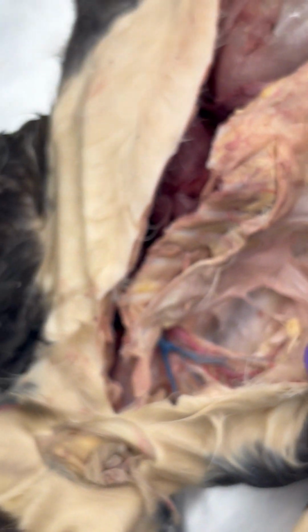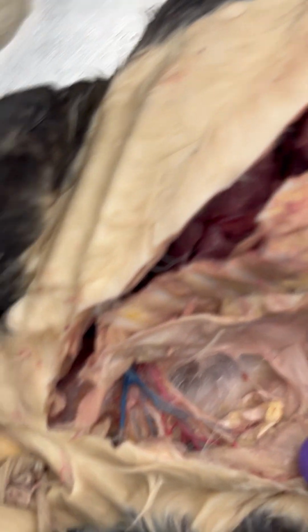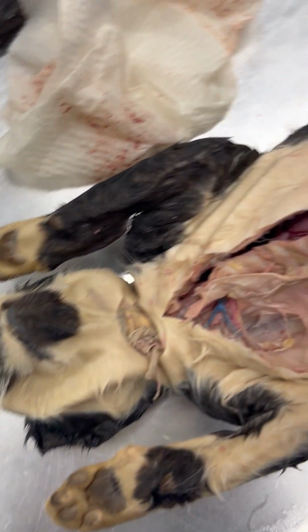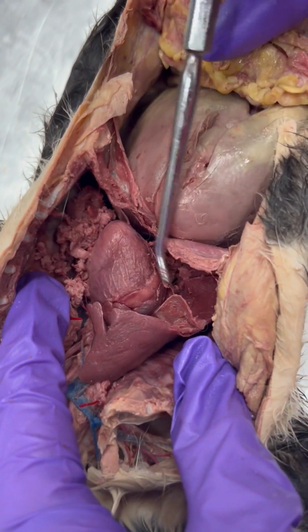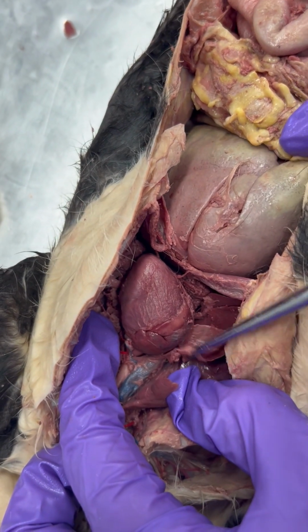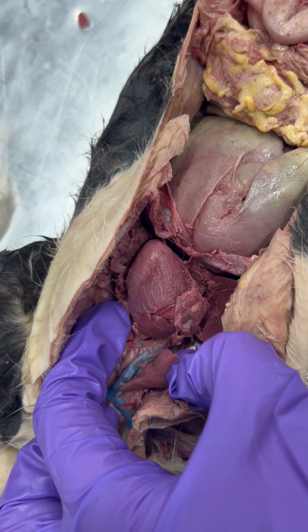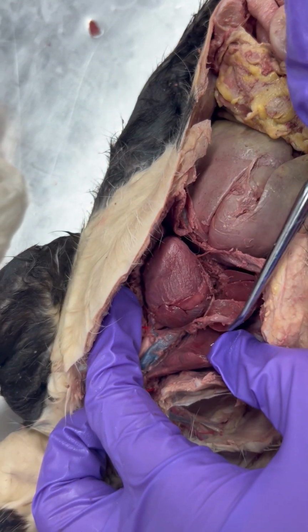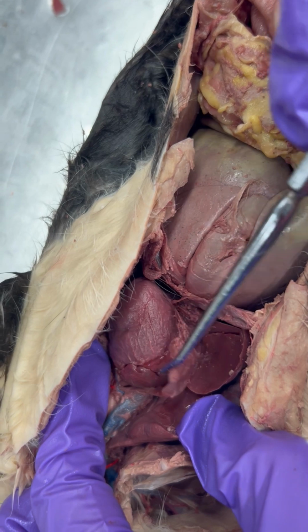Moving on to our next figure, because that was all for figure 8.13. One final thing from that figure, which you should know by now, is the pericardium, which is the sac that covers the heart. As we know, we've seen a similar structure in the lamprey, we've seen it in the frog, so that one is definitely expected for you to know by now, but just for repetition's sake, we have the pericardium.